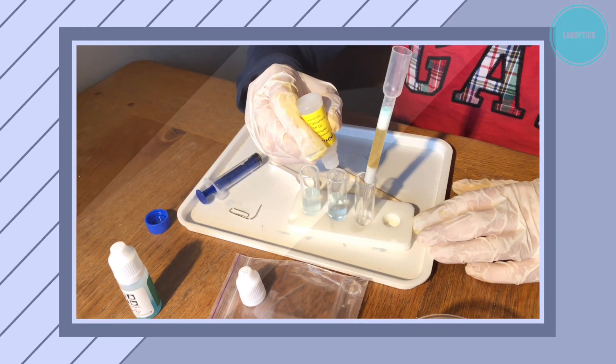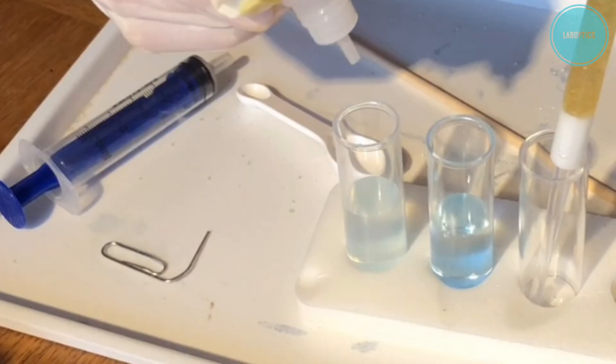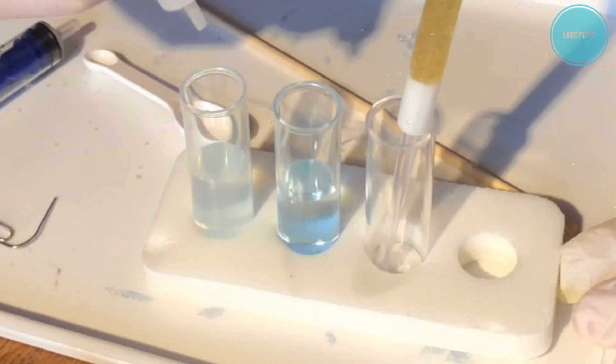In due course we will add 5 drops of ammonium carbonate solution to both of the vials. Notice how the colour of the liquids in each vial are now different.